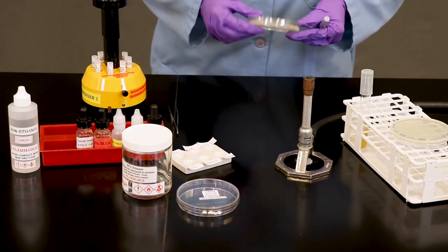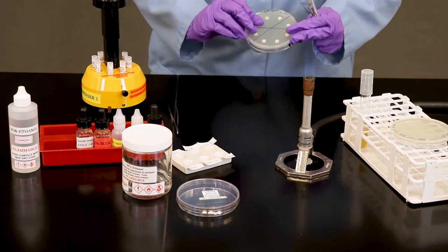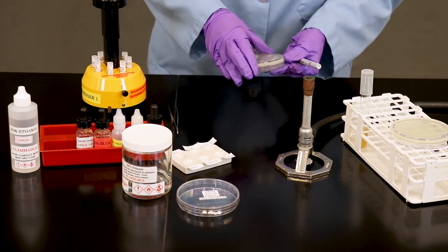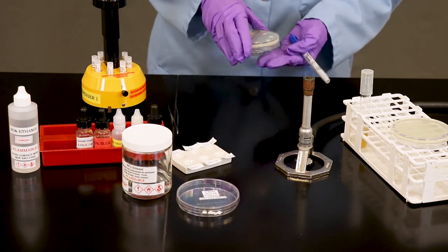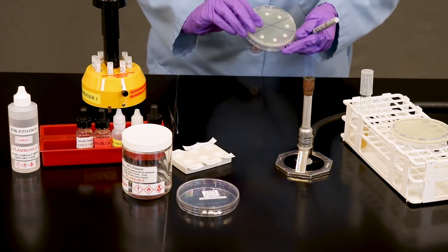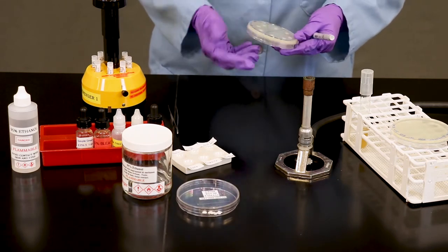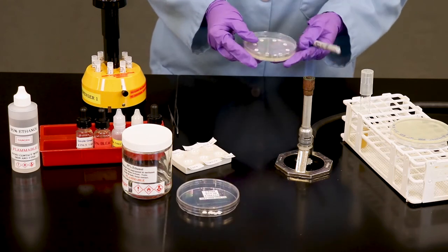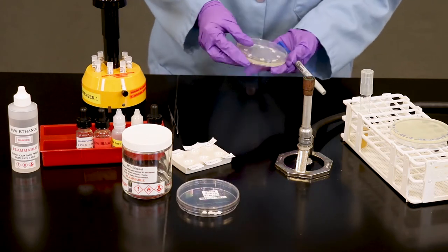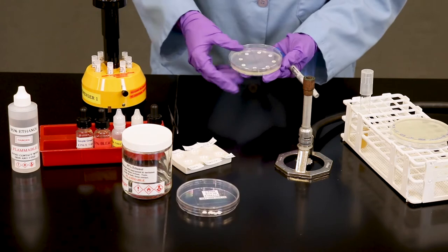A lot of instructors, it depends on the individual. Some microbiologists like to leave the petri plate with the lid down to avoid contamination. Sometimes, on occasion, these discs can fall off. So, if the petri plate looks really dry, it's not terrible if the lid is on top of them.